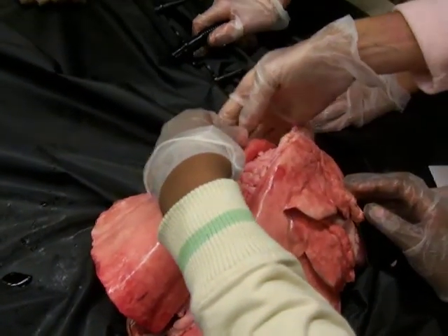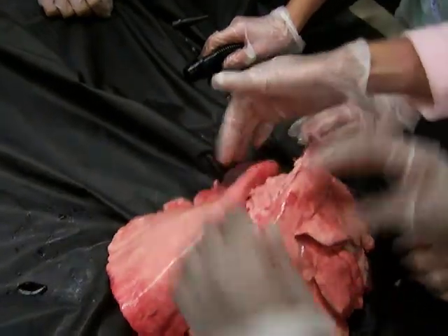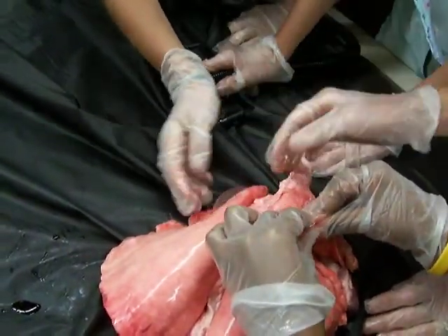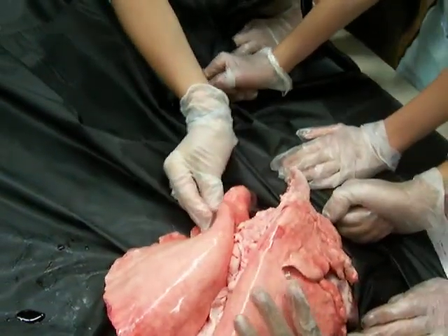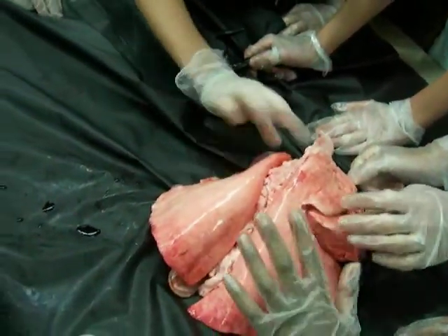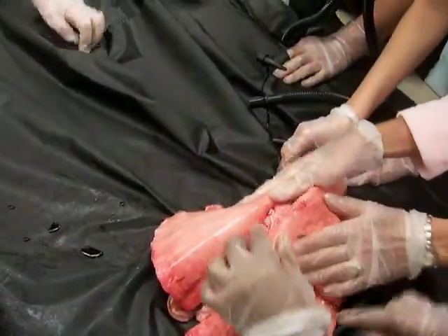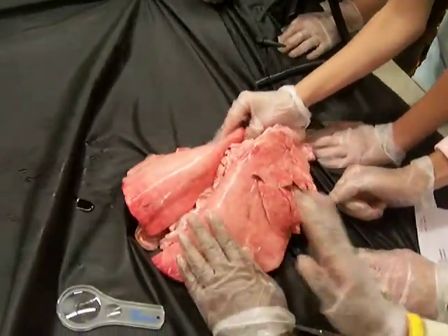It's when you've over-inflated the lung and you've caused some of the air to pocket like that. And when people get emphysema from smoking, this can happen to your lung. And if that bursts, you have to go to the hospital because you need a chest tube. We don't want to over-inflate our lungs again — that should go back down. Those are blebs.